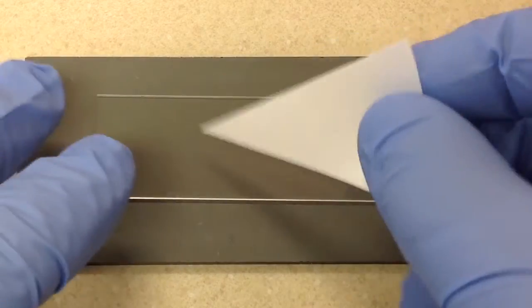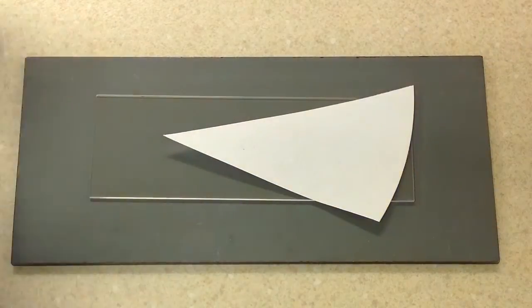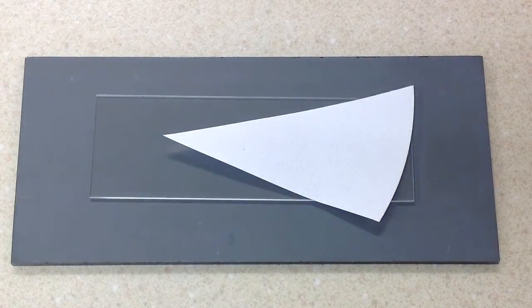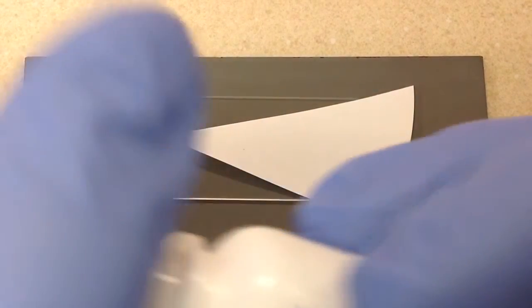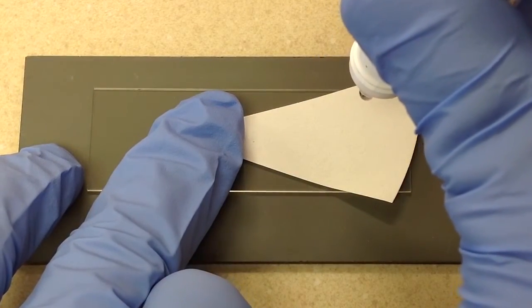So to run this test, it's pretty simple. It's a rapid test. We're just going to take a piece of filter paper and put it on a regular slide, nothing special about it. I just cut that filter paper up, and I'm going to take one drop of reagent and drop it on there.